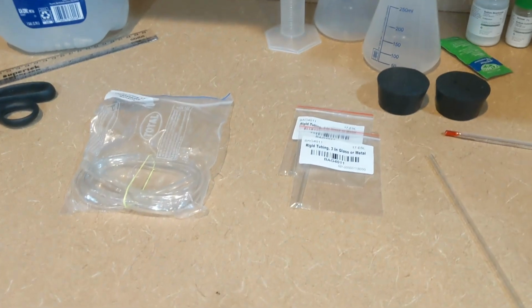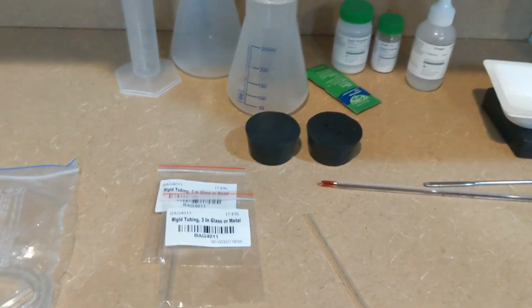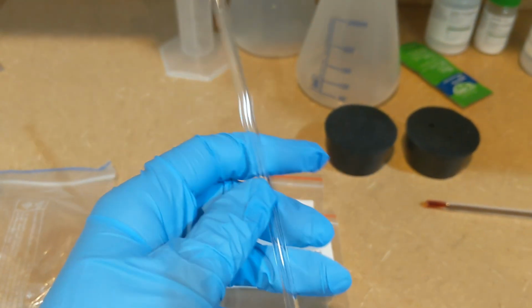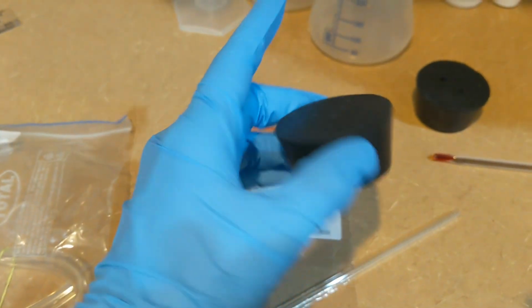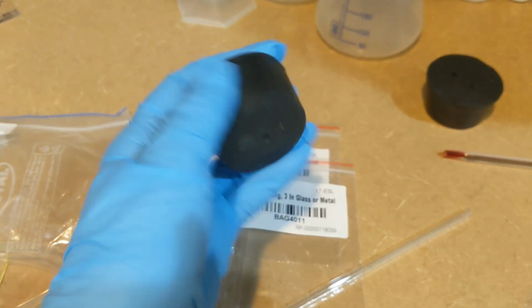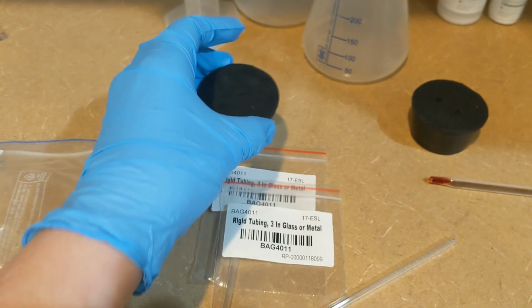In terms of safety preparations for this lab, of course, I will be wearing the splash goggles since the chemicals that we're going to be using are very irritating to the eyes. Other concerns that we have involve broken glass, since we do have these glass rigid tubings. For this, we are going to be using the petroleum jelly to make sure that the rigid tubing is very well lubricated when they're being inserted into the stoppers. Another precaution will be when inserting the tubing into the stoppers, using a twisting motion so that we're relying on torque instead of pushing the rigid tubing in, which could cause it to break.